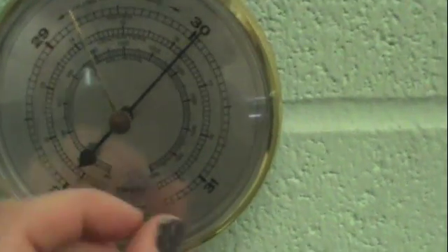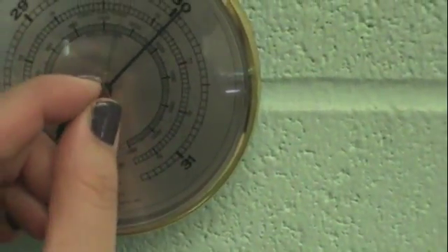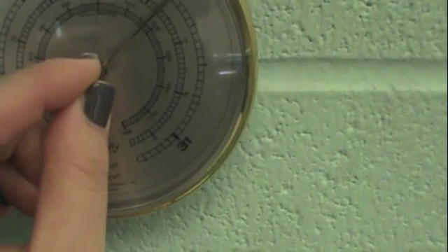You may also need to obtain a barometric pressure. The barometer is in the balance room. Just line up the needles and read the marking on the barometer. Here it's 762 mmHg.